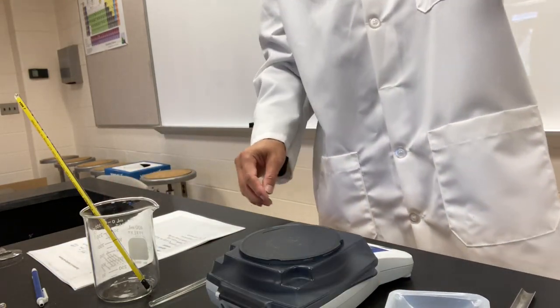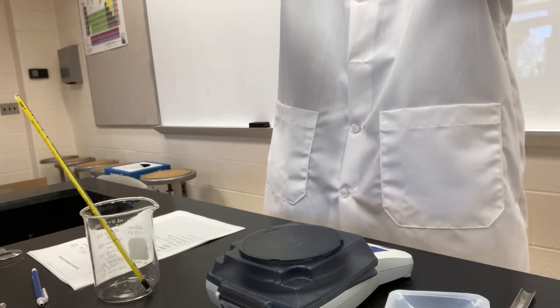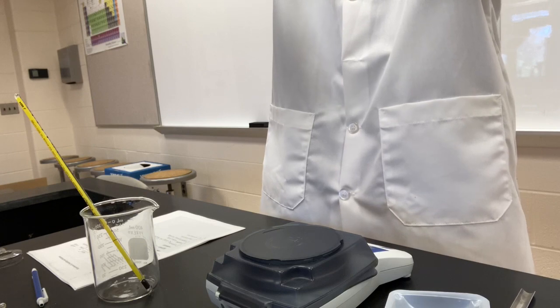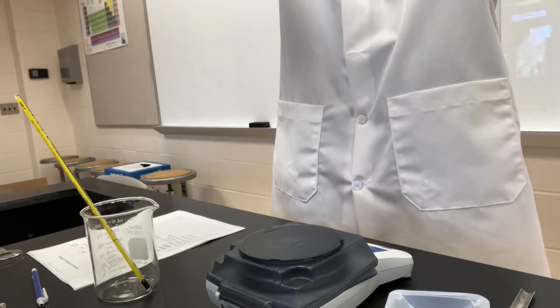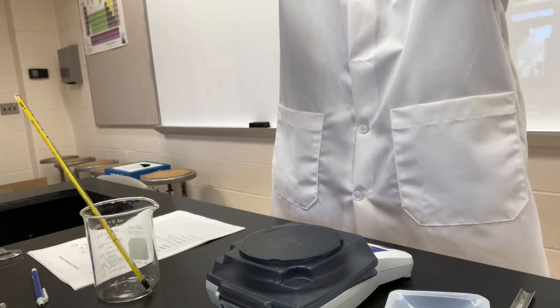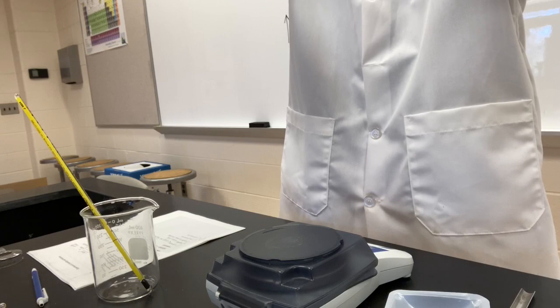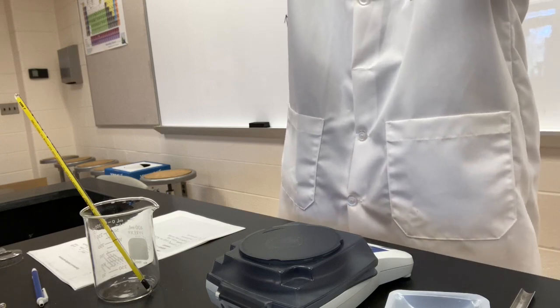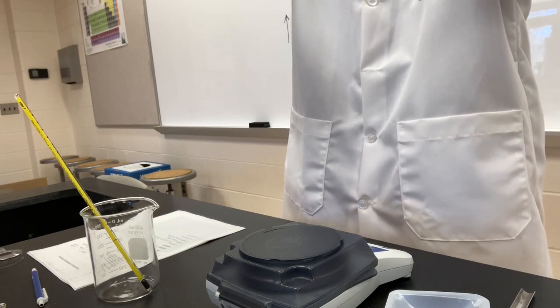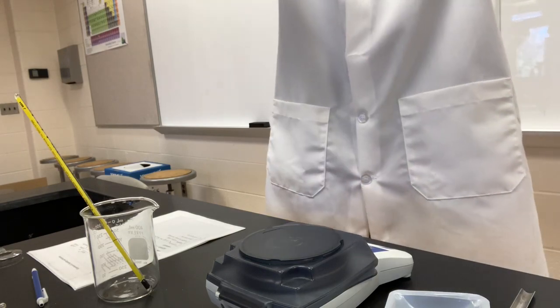And we'll shake it. We will stir it to see if it all dissolves. If it all dissolves, we'll keep adding potassium nitrate. If it doesn't, basically the solution is saturated with 2.385 grams of potassium nitrate at room temperature. We'll give it some time. We'll keep shaking, stirring.